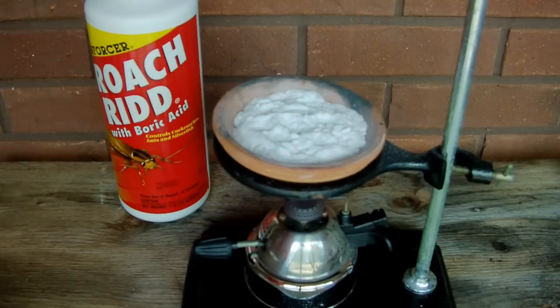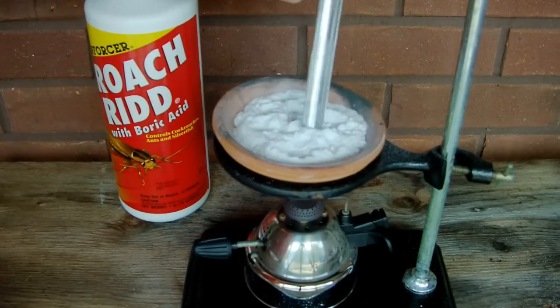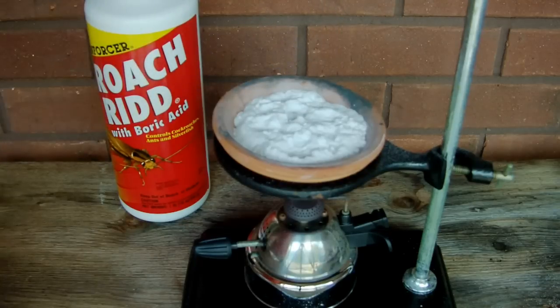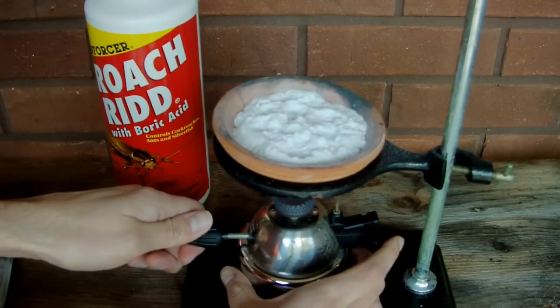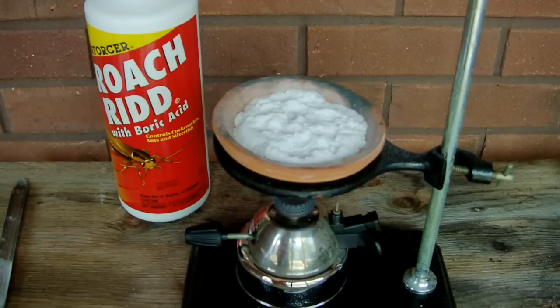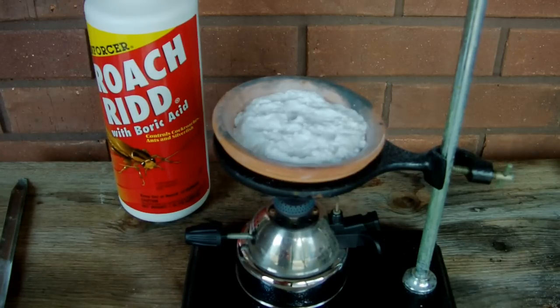The first thing we're going to do is dehydrate the boric acid into boron trioxide by heating it. The boric acid is a really light, fluffy powder, sort of like powdered sugar consistency. We're going to heat that up and try to drive off the water. I'm doing this in a ceramic flower pot base because boron trioxide is supposedly very glassy, and I imagine it'll be pretty hard to get off whatever container I use — so I'm using something I don't mind destroying.